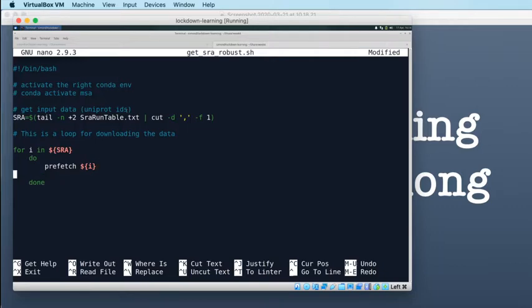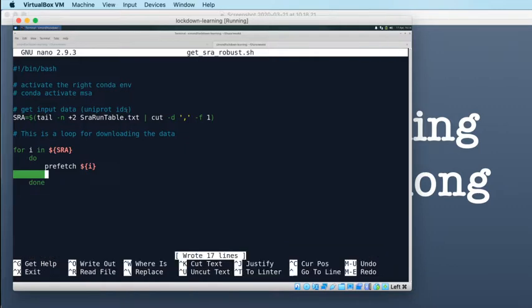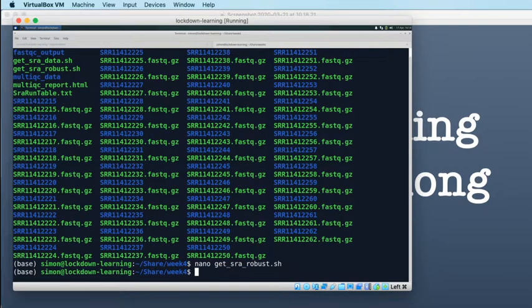But I only want to do that if the FastQ doesn't exist, because the Prefetch will check for itself, but FastQ dump won't. So I want to put that if statement in here that I had in the previous script. So I'm going to save this and exit just so I can get the if statement from the other script.